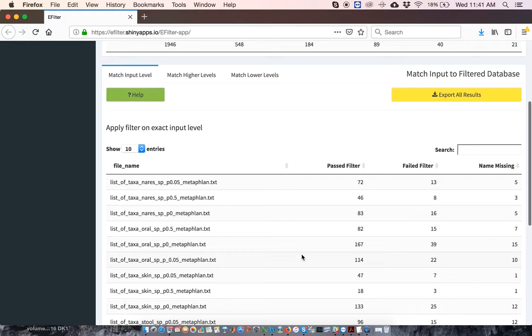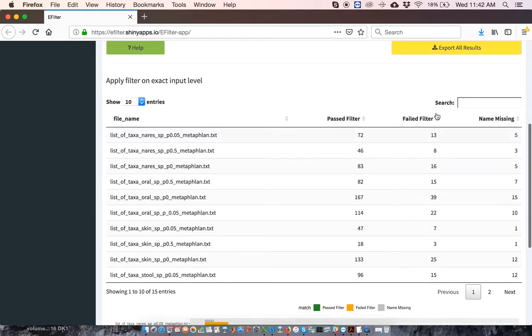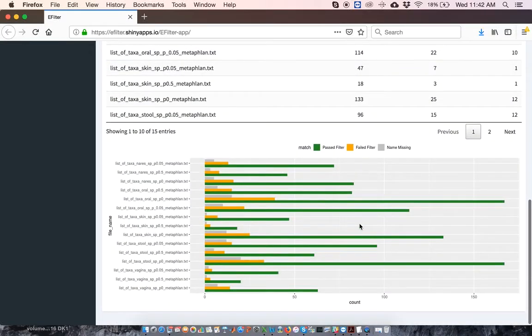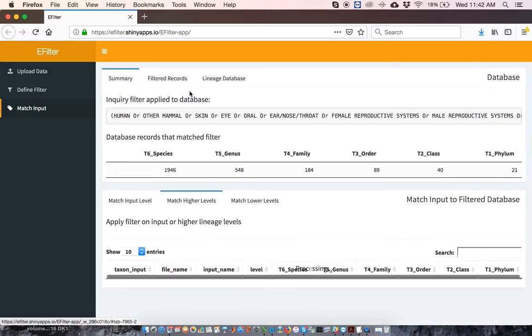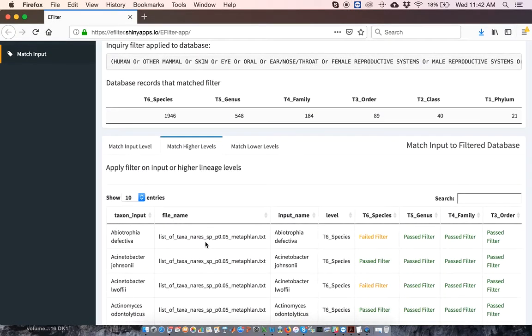For each file, EFilter then outputs the total number of taxa that passed, the number that failed, and the number whose names were missing. Passing means that the habitats selected in the filter are known habitats for those taxa. Passing and failing information is presented both as counts and in graphical form. If you want to know which organisms passed or failed the filter and at what taxonomic rank the failure occurred, you can click on the Match Higher Levels tab. This breaks down passing and failing taxa by file and by taxonomic rank.